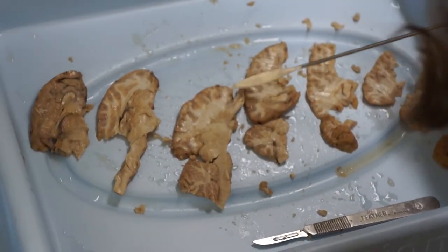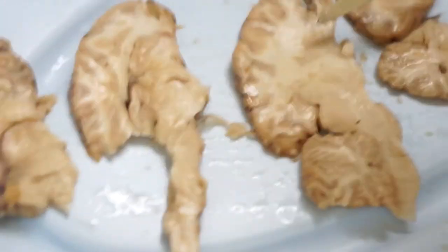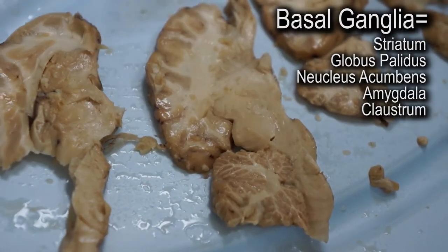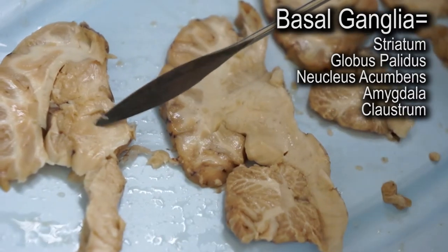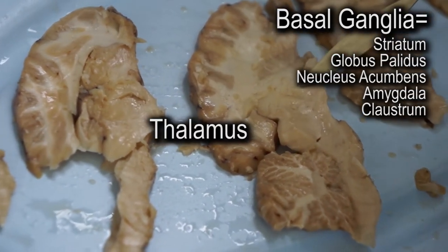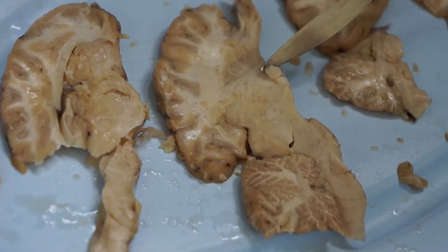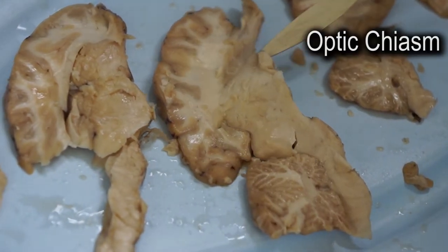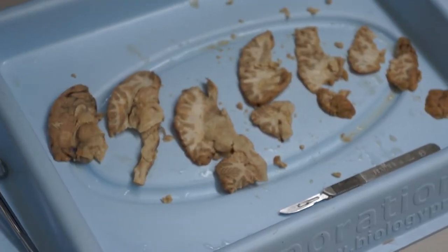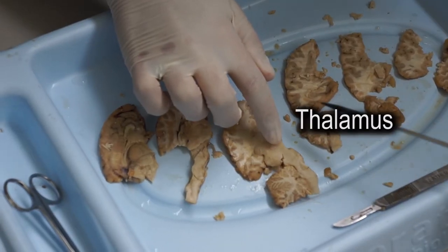Let's see, what is this? Olfactory bulb? What is this? Basal ganglia? Yeah. What is this area here? That's the thalamus. It's a piece of the optic chiasma. This is the thalamus.